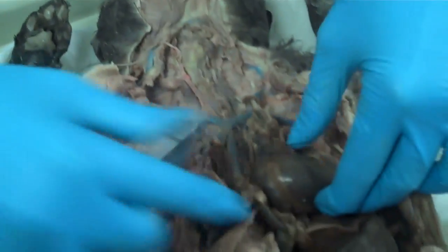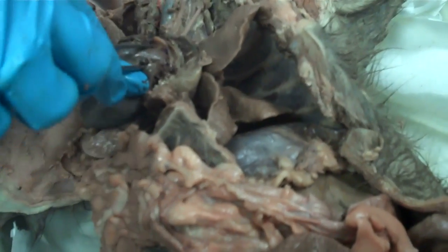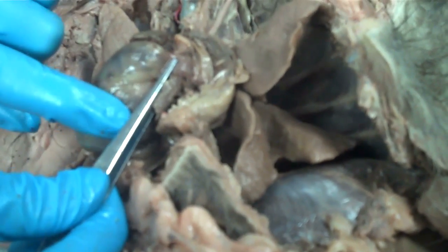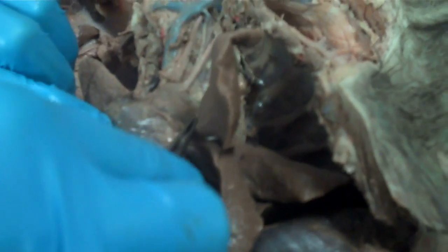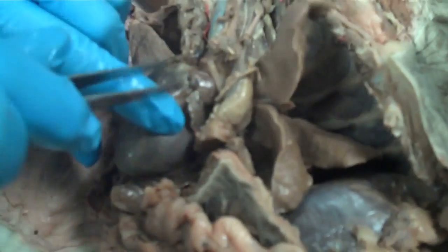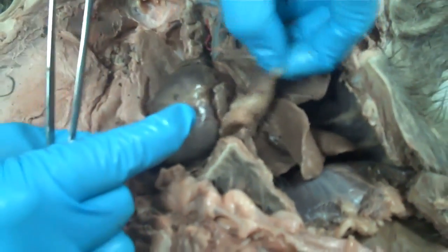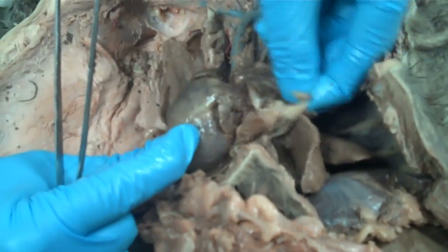The other thing you find on the heart is the pulmonary trunk, which actually goes underneath the aorta. That's the pulmonary trunk, and look where the aorta is — right there. Most of the time you do have to sort of remove the pericardium to see it; otherwise it's kind of covered up.